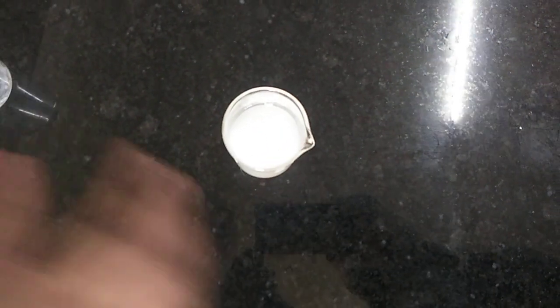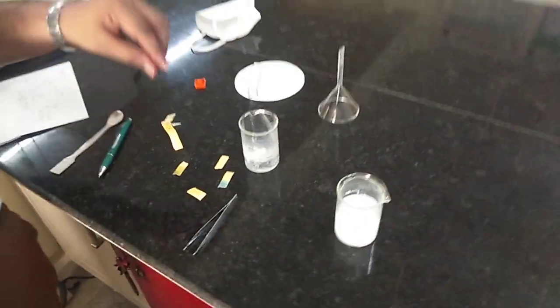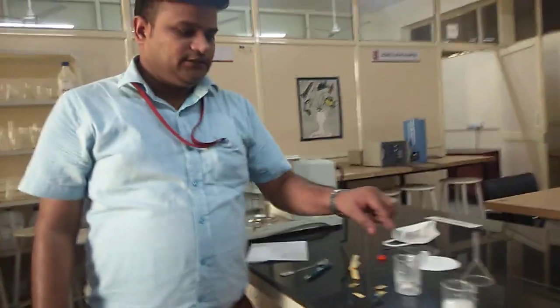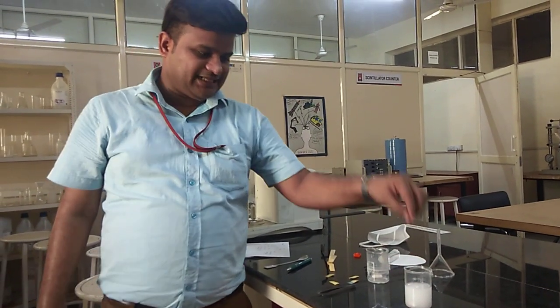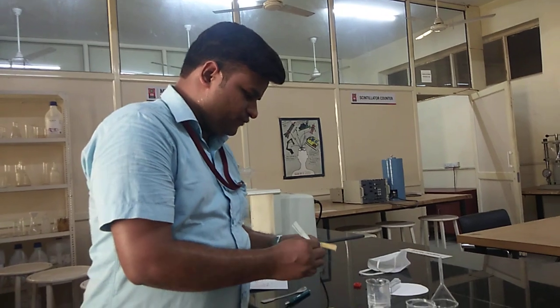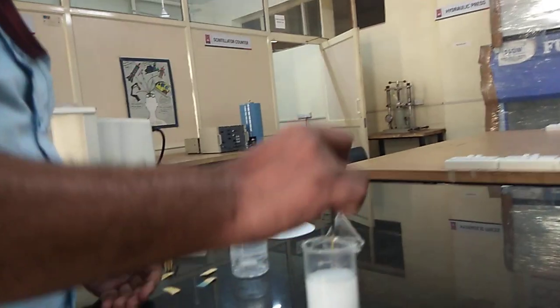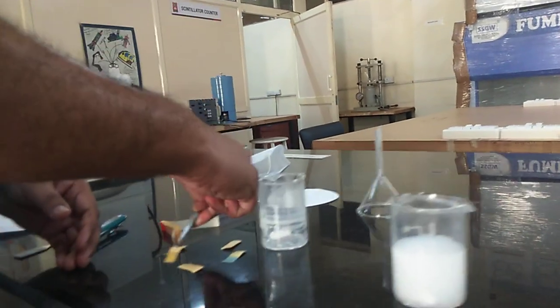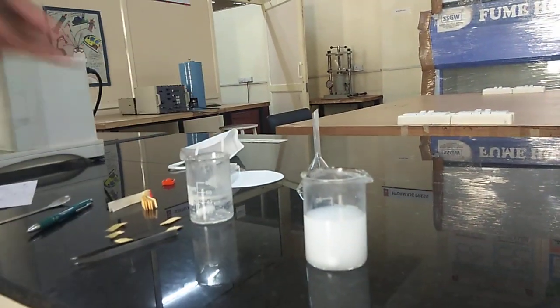We will repeat this process — keep on adding the NaOH solution until the pH value reaches 8. Checking again, the value is still 7, so we will continue adding NaOH solution until we achieve the target pH of 8.